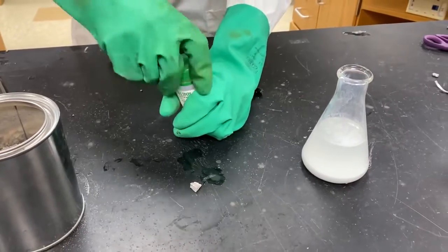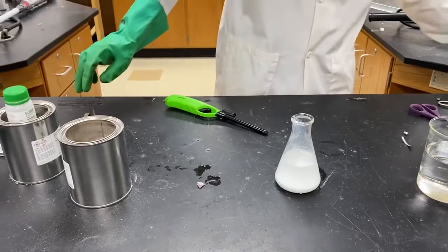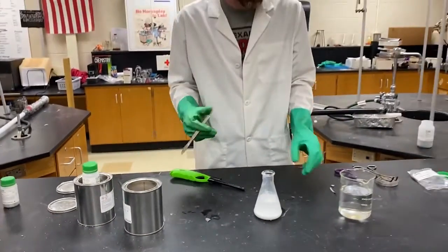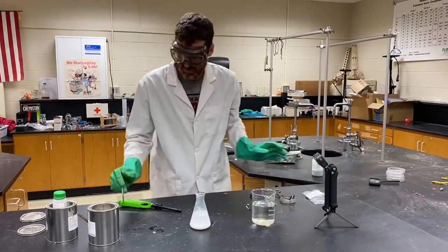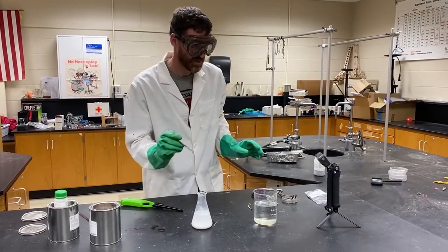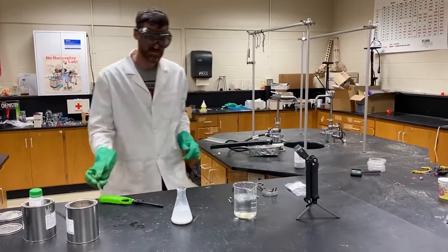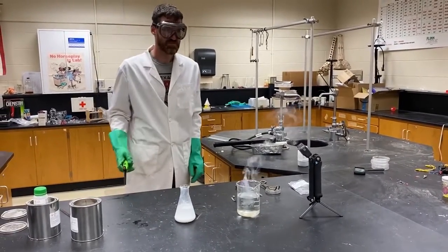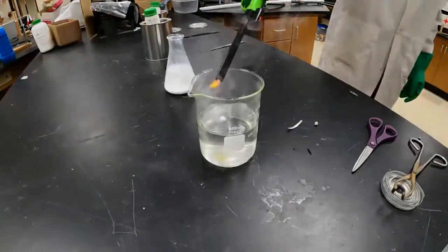All right. So, taking appropriate safety precautions, we have my goggles on, have my gloves, and we're going to see how this reacts. I'm going to light it.